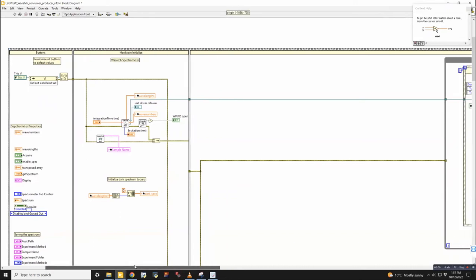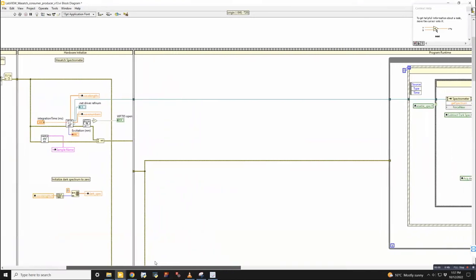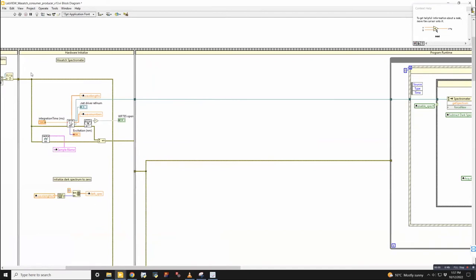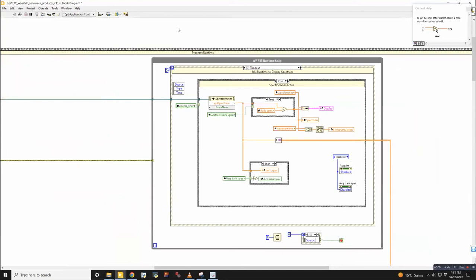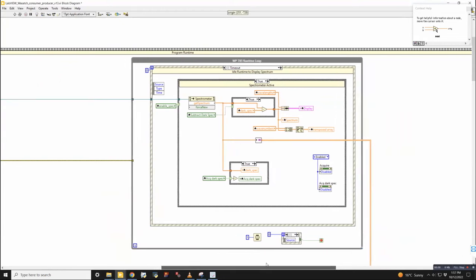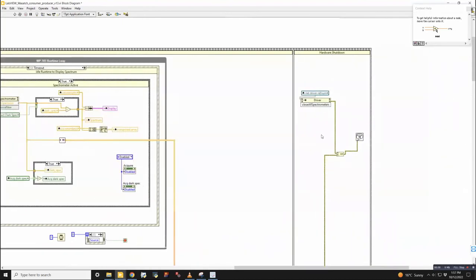So then in principle, there's three main things that are happening in this VI, and they happen in sequence. First, you initialize your connection to all the different hardware. And then once you've connected to all the different pieces of hardware, you go into runtime, where you're looping indefinitely and waiting for user input. And then the last piece of user input is, I don't want to use this software anymore, and you want to shut down all the hardware. So then that's the last loop over here.